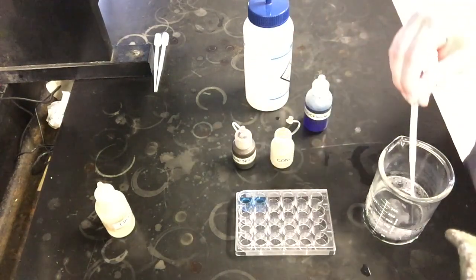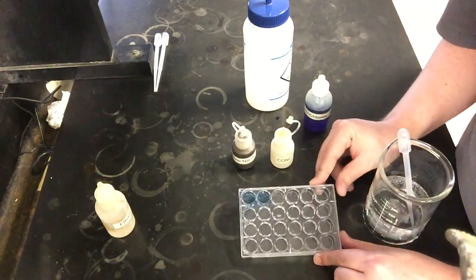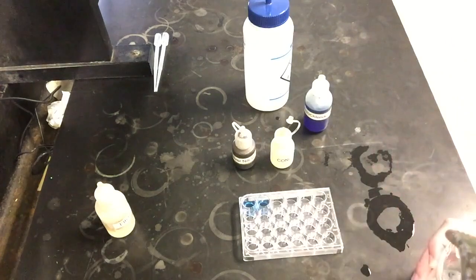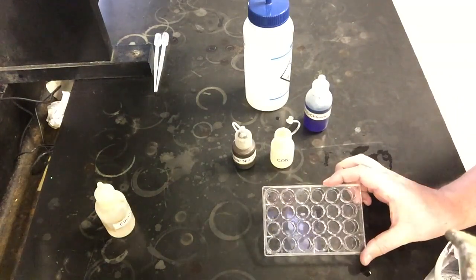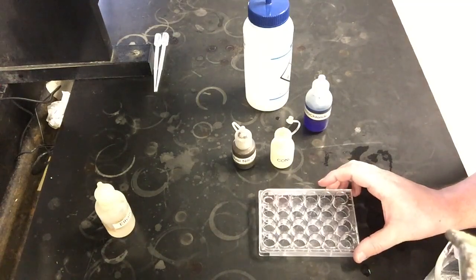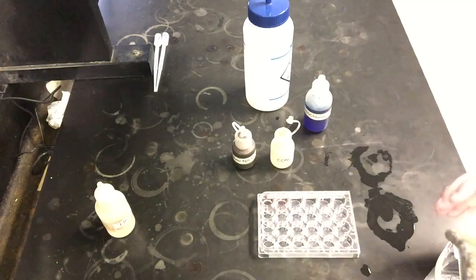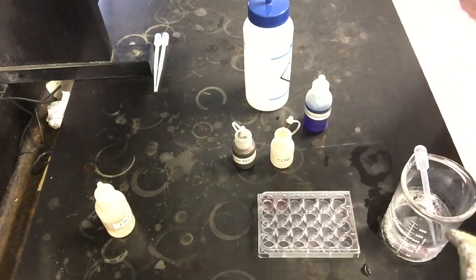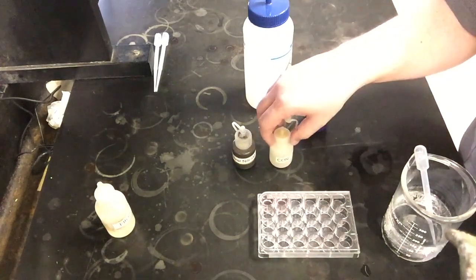And we see that the blue color might be a little difficult to see, but the blue color has definitely gotten lighter. And if I stir this a bit, my guess is it's probably going to get a little bit lighter yet. In fact, as I stir it, you see them actually might look even clearer, but they do have a slight pink tinge to them. So they have kind of a slight pink color, which is the color of the complex these things make with water.